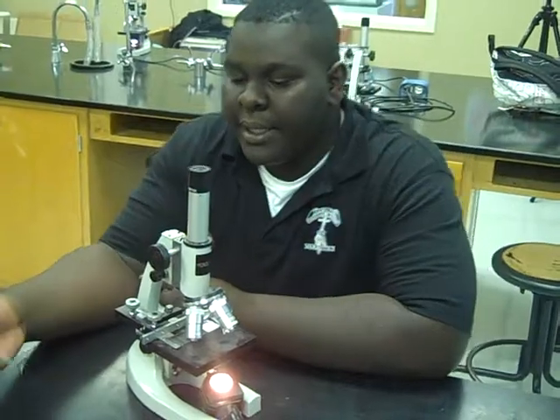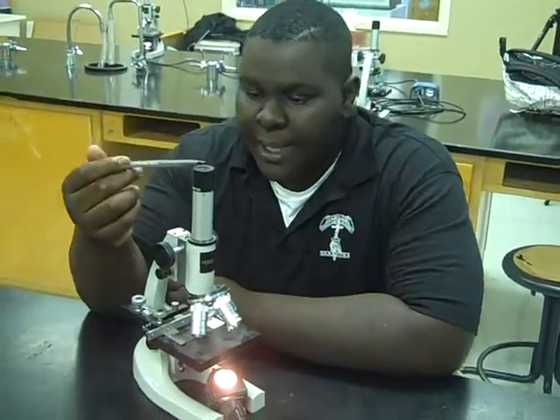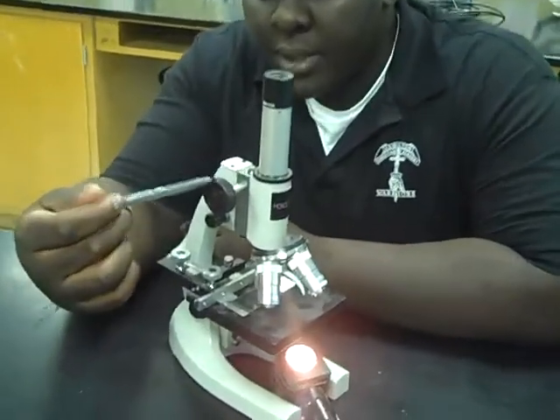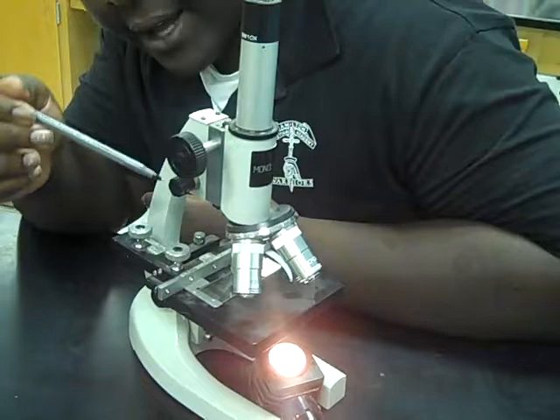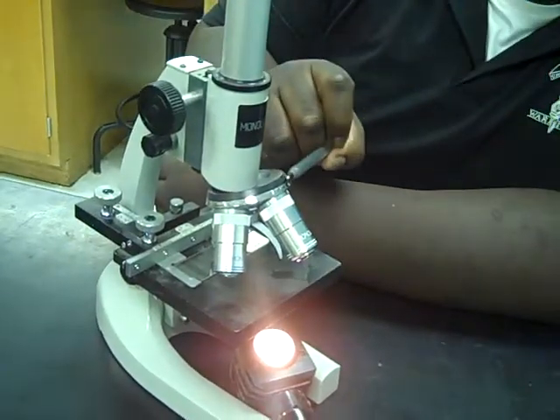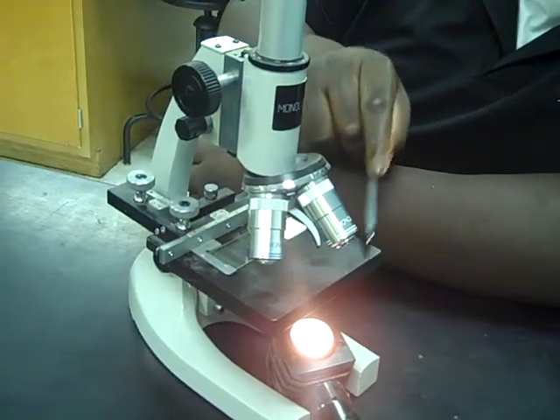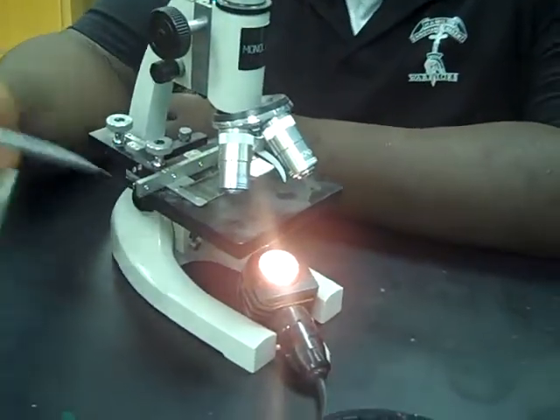Now I'm going to explain the eleven different parts of a microscope. There's the eyepiece, there's the body tube, there's the coarse adjustment knob, then there's the fine adjustment knob, there's the revolving nosepiece, there's the objective lenses, and there's the stage.